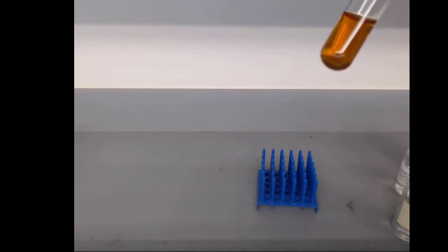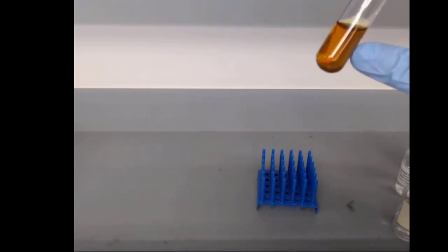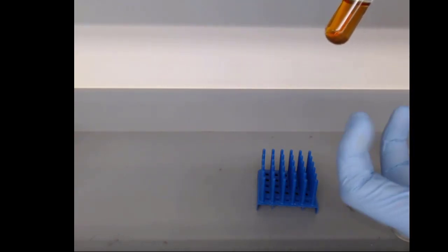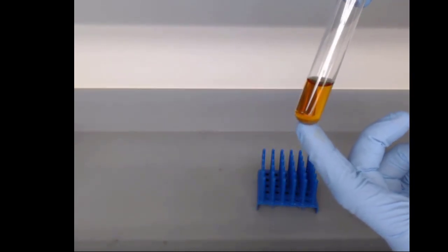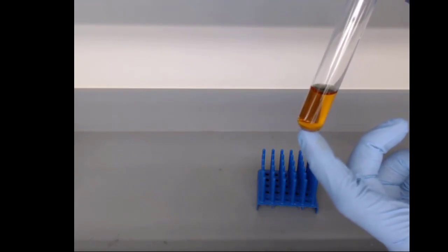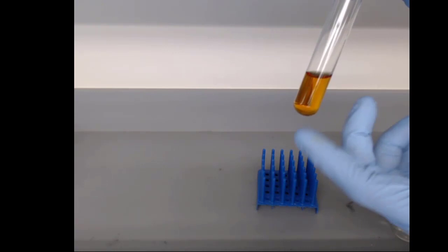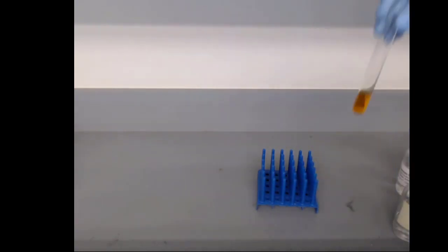The chlorine has become sodium chloride in solution, and that is iodine, I2, in the aqueous solution. Because I2 has a bigger electron cloud than chlorine, it's more soluble in water because it has a stronger London dispersion force than chlorine does. So this will stay. If I leave this out, eventually that color will disappear just as the iodine slowly leaves solution. But for the most part, this will stay a lot longer than the chlorine will.